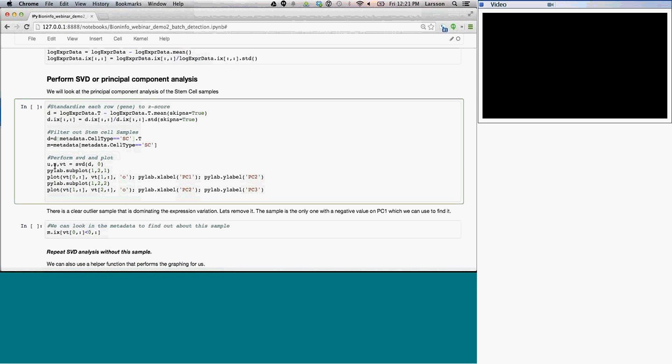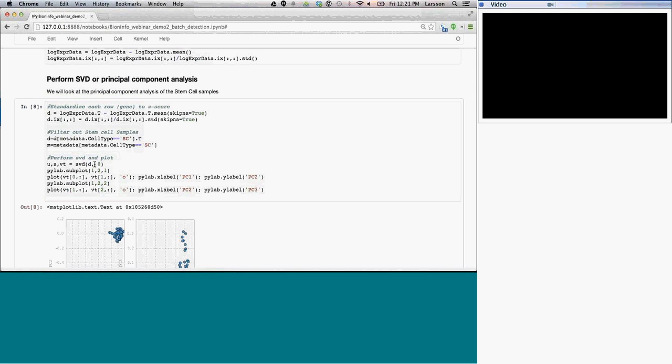And lastly, I'm going to perform a singular value decomposition. So I pass in my data matrix, and I get back these three matrices, U, sigma, and VT. And then the last thing I'm going to do is plot the first singular vector versus the second singular vector in the first plot, and then a second plot with the other vectors, so we can see what these look like and see what the variation is. I'm not color coding by anything like that.